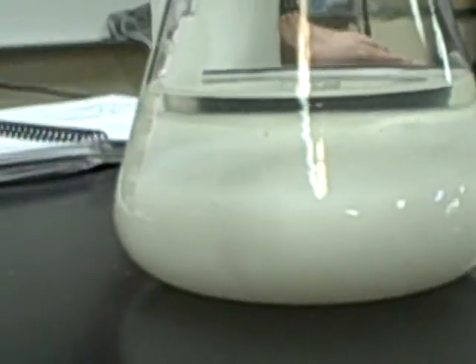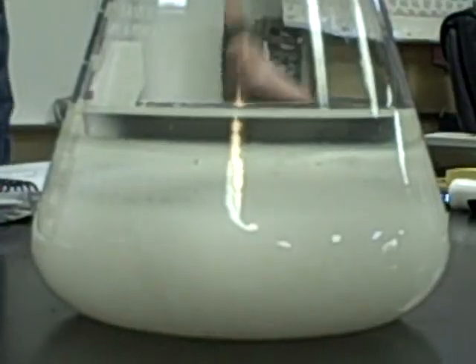So now when that crystal finishes growing, what type of solution will I have again? So it's gone from supersaturated back to its... Let me pick this up and just hold it at an angle for you.